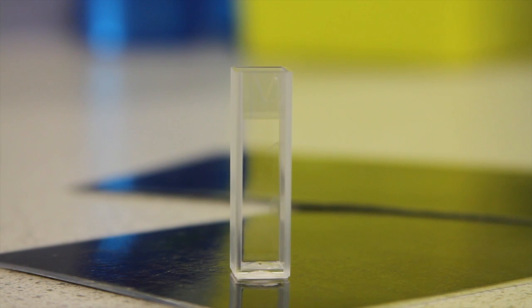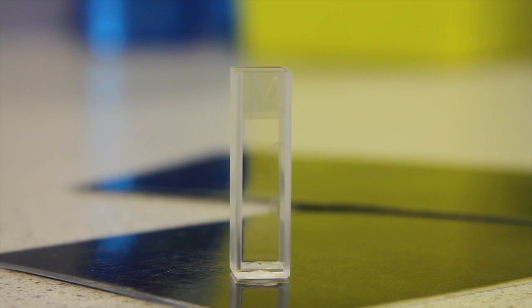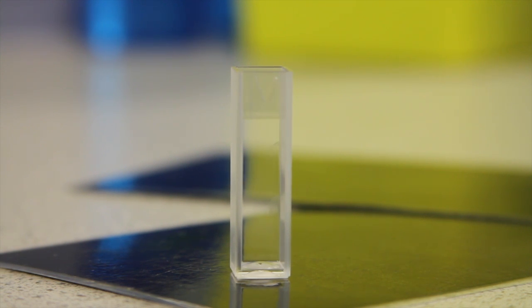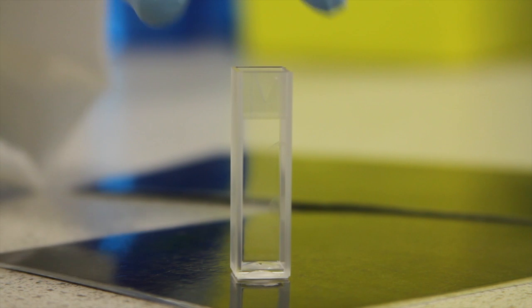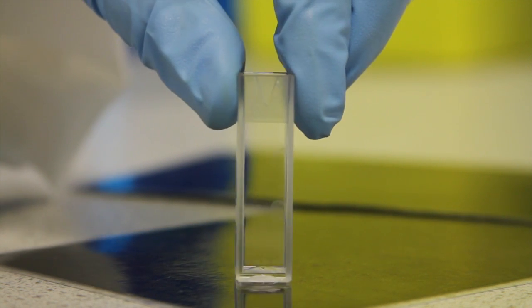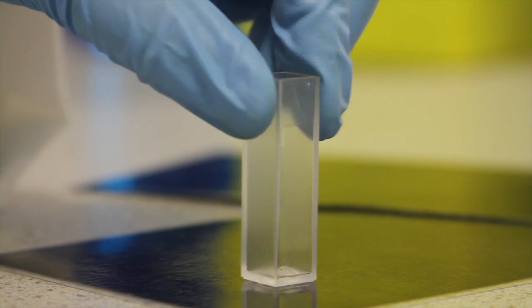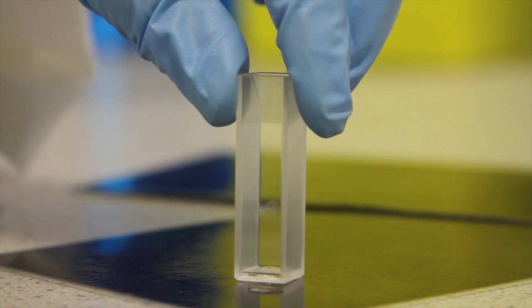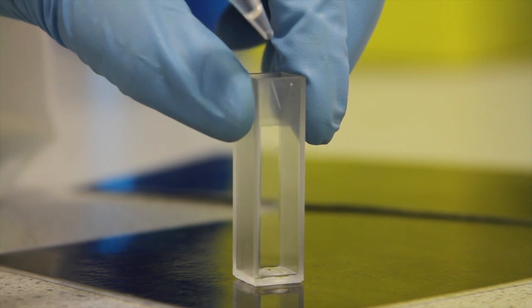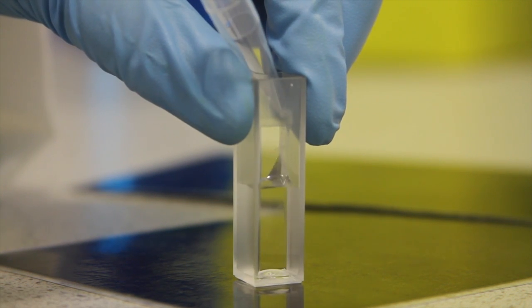This is the cuvette used in the spectrophotometer. It is one centimetre wide and one centimetre deep, giving a path length of one centimetre. Notice that two sides of the cuvette are not transparent. This is important when positioning the cuvette in the spectrophotometer, since if the etched side was in the line of the light beam, this would affect the result.